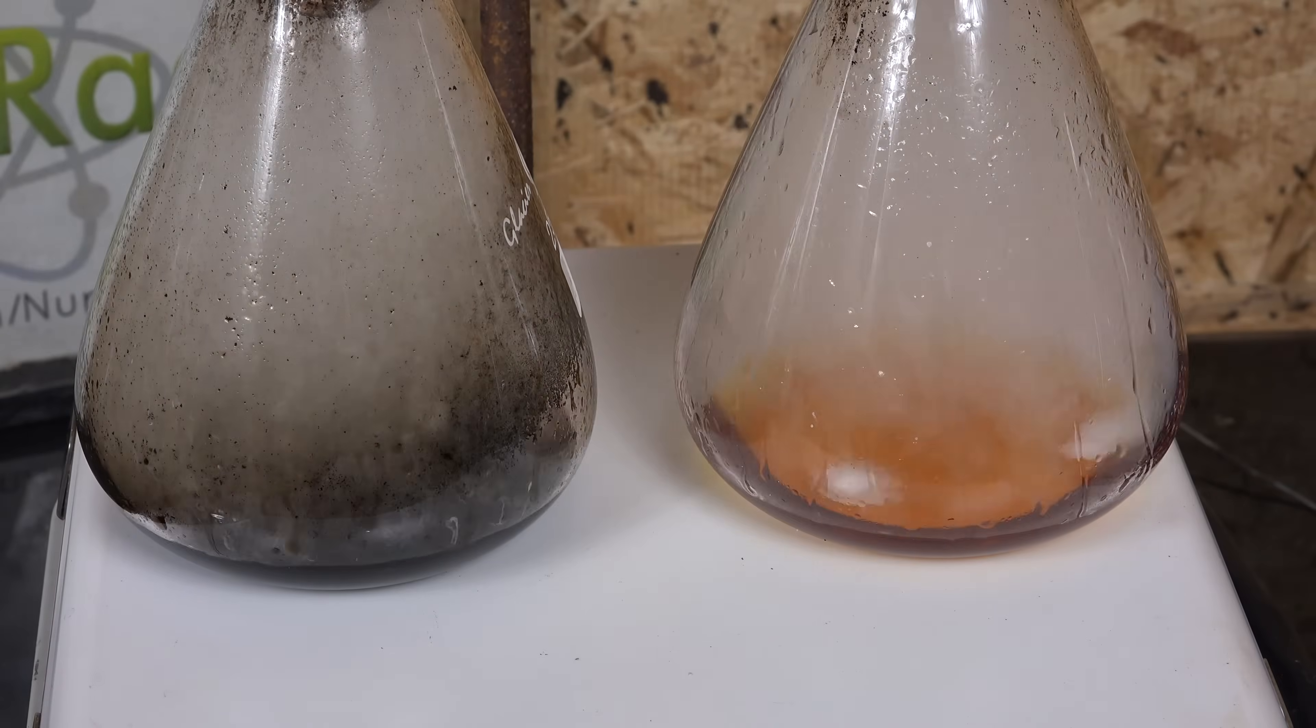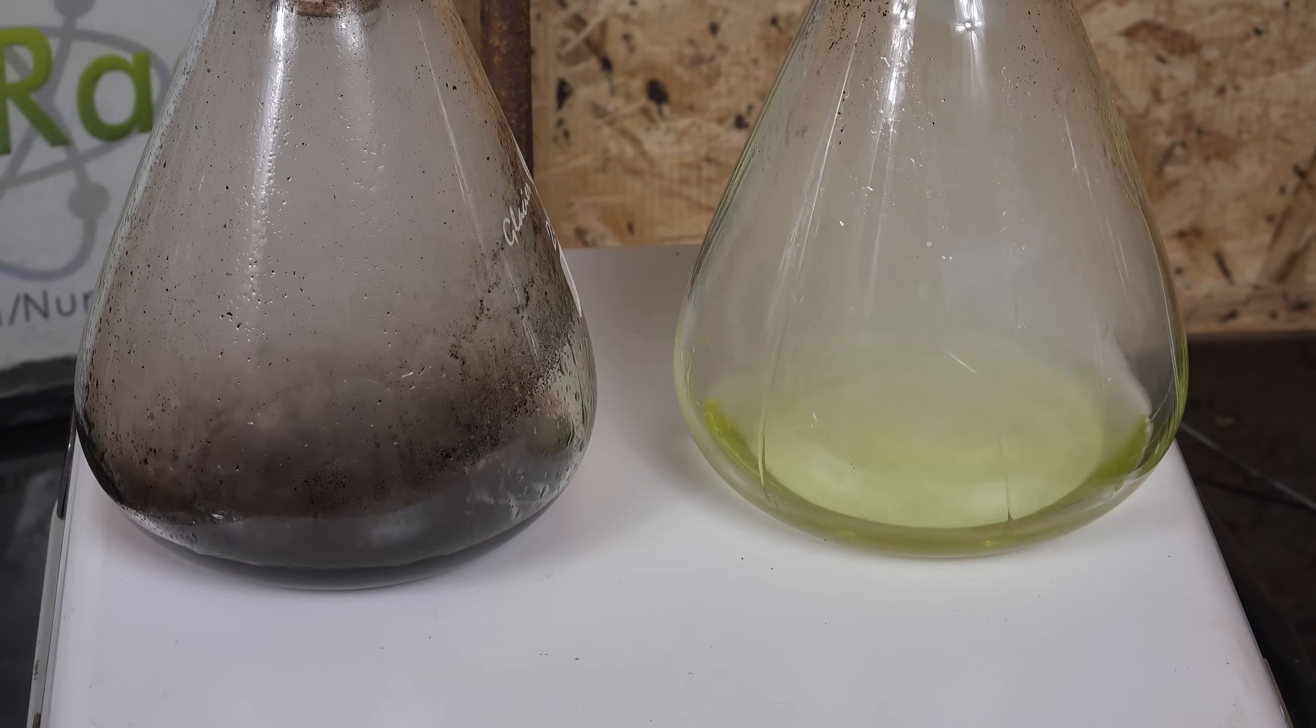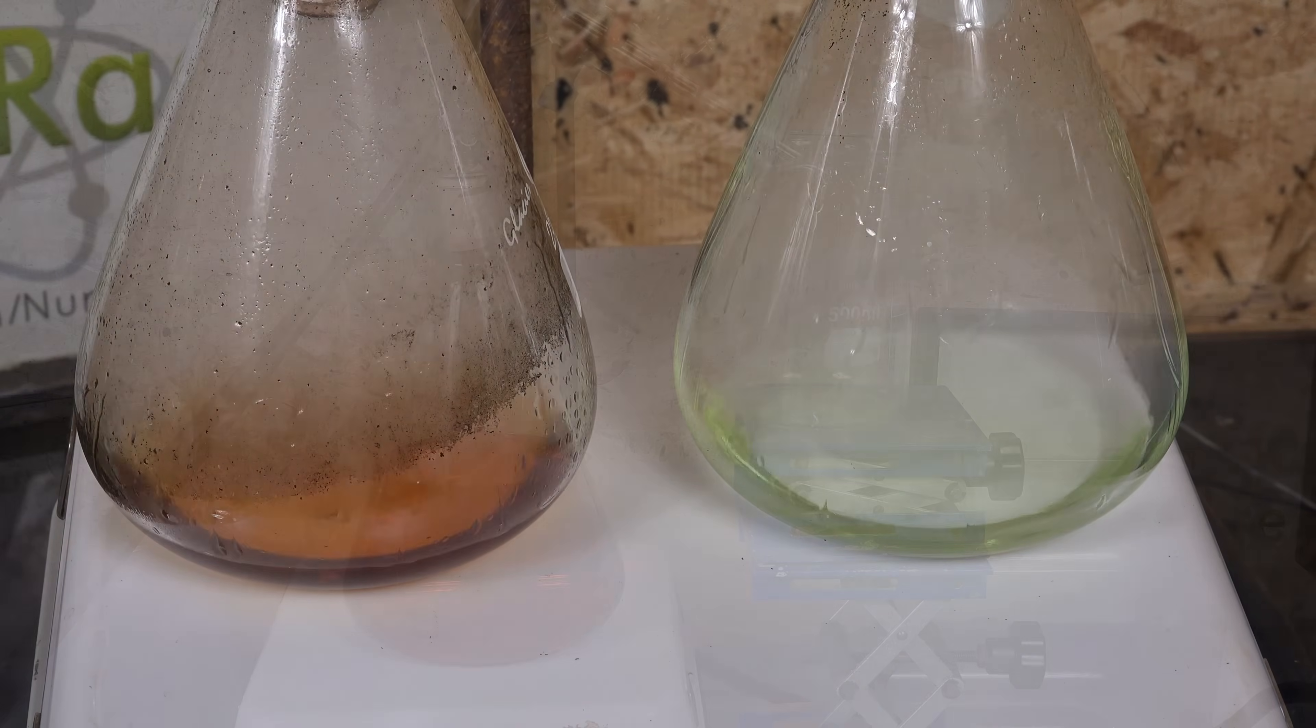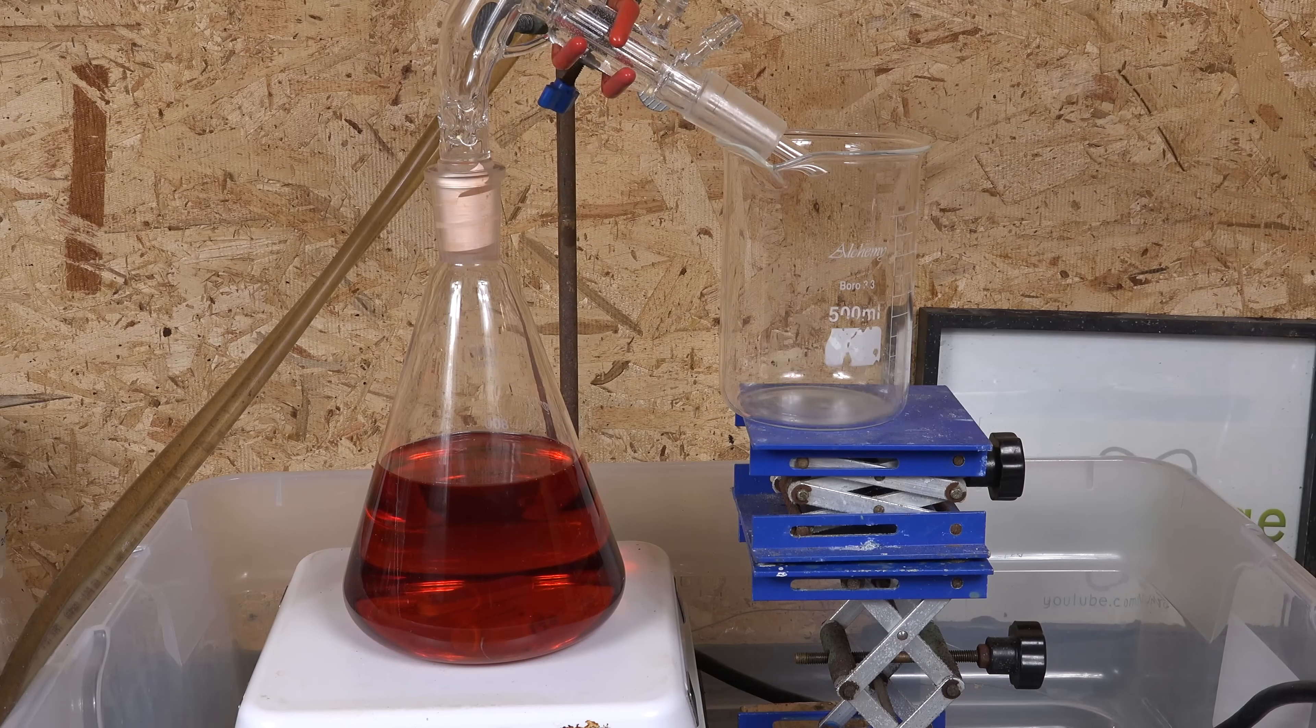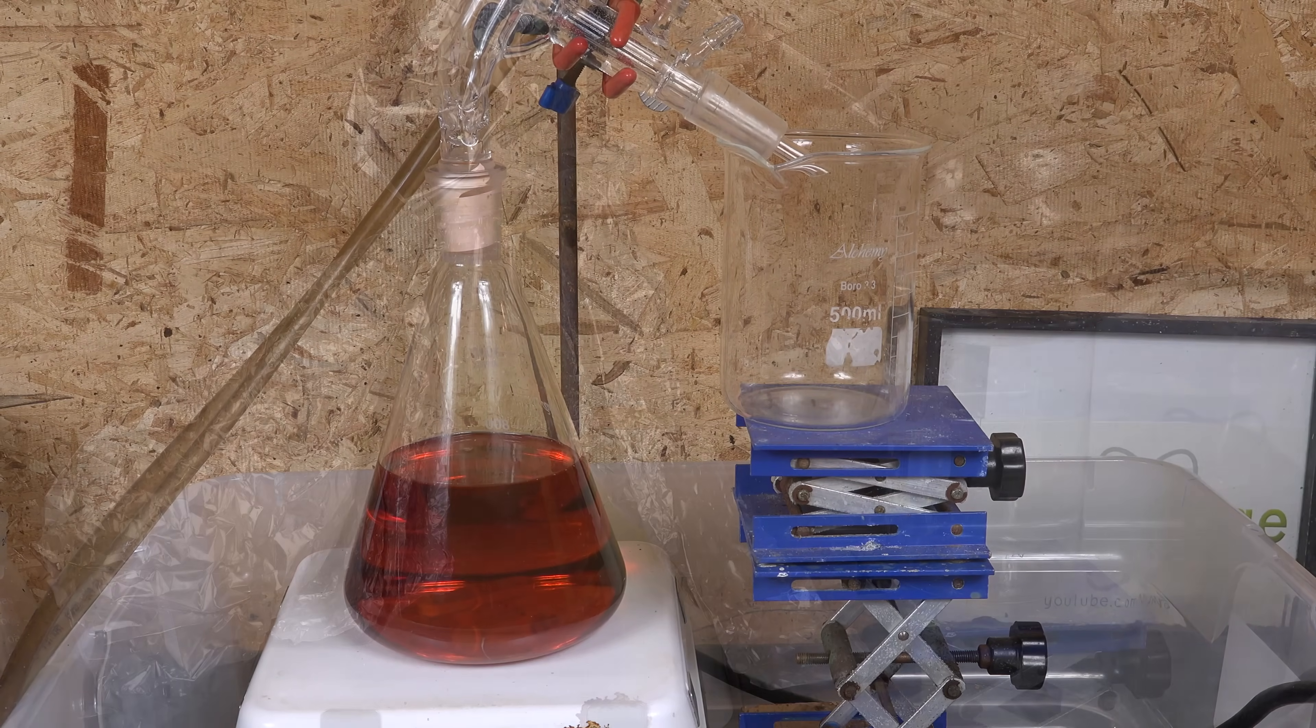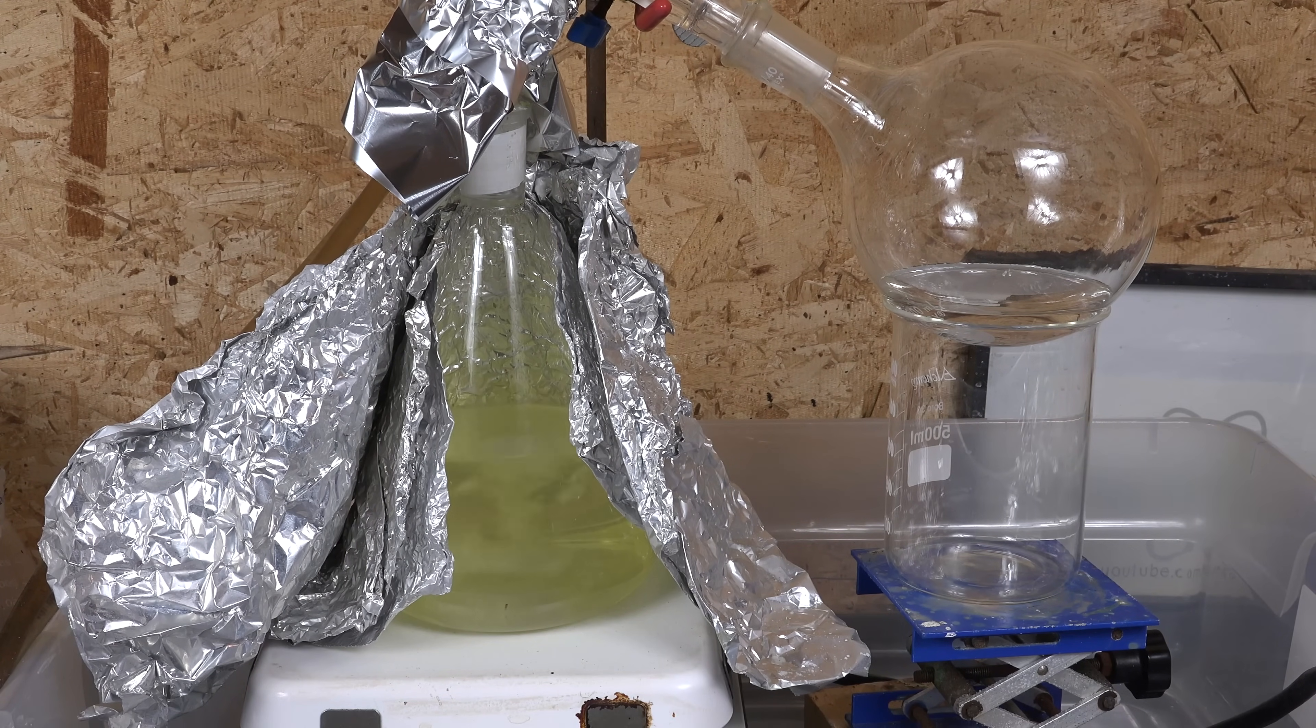Greetings fellow nerds. I need purified lab grade sulfuric acid again as I'm planning to do experiments in electroplating and analytical chemistry. While using drain cleaner sulfuric acid is good enough for a lot of purposes, I need something better. So I'm going to revisit one of the more dangerous amateur chemistry procedures and distill my drain cleaner acid to purify it.